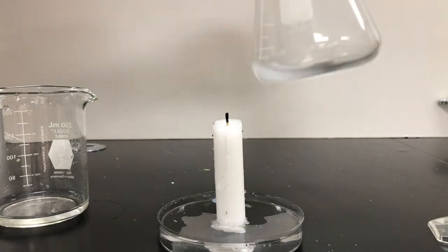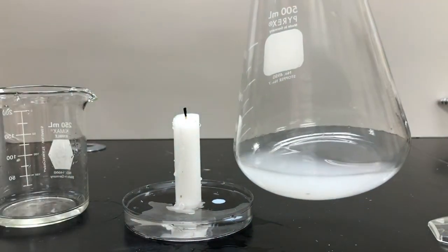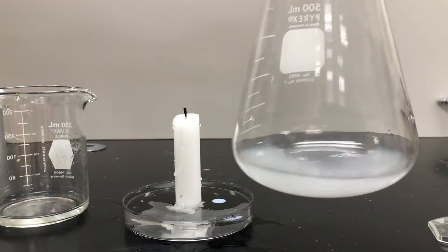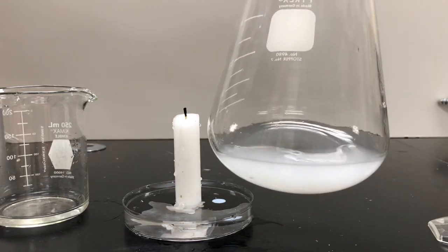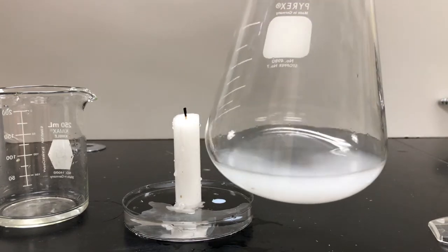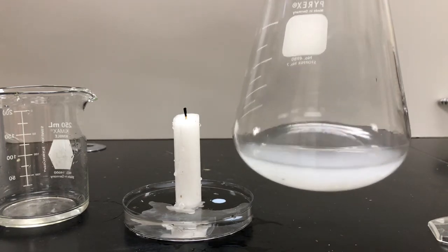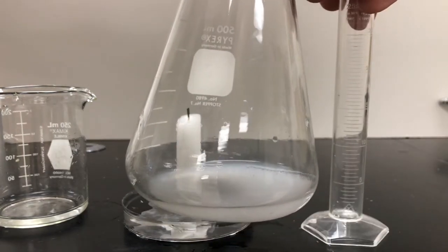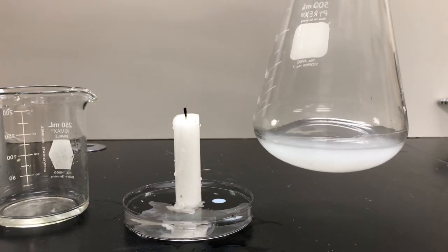And you'll know that the liquid, I'll pull this to the side here, got pretty cloudy. And that means that if lime water reacts with carbon dioxide, the lime water gets cloudy. Now we'll talk about why this is later in the year, but that's a test. It's a positive test for a lot of carbon dioxide, which obviously wasn't in the lime water before, because the lime water was in the graduated cylinder and it was clear earlier. Okay? All right, check that out.